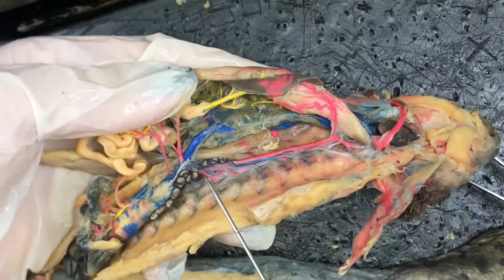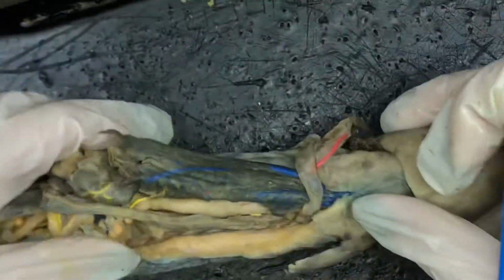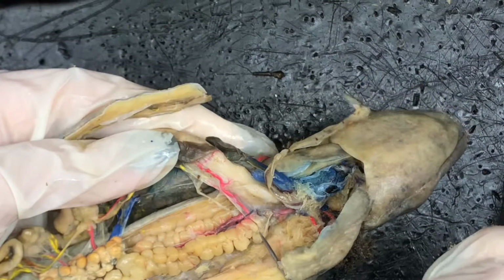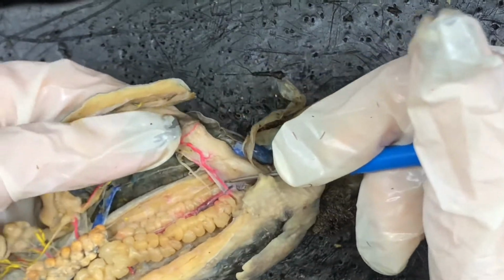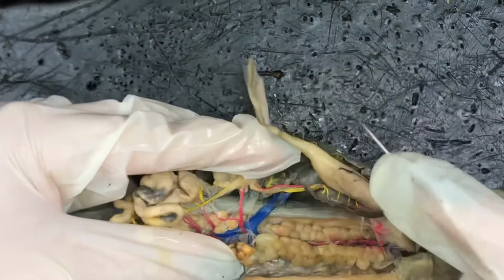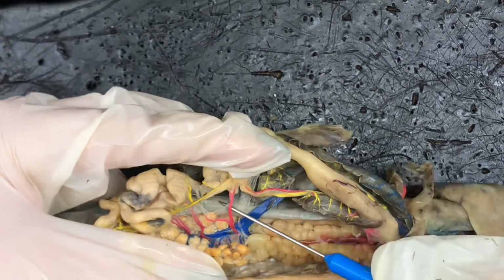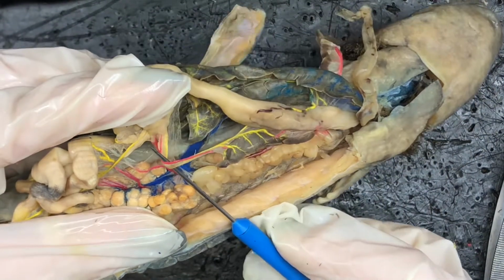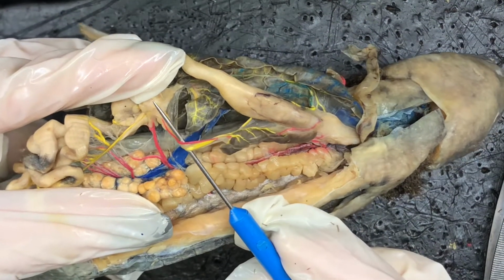And then next we're going to go down. Our next branch will be the coliaco-mesenteric artery, and we can actually see it better in this Necturus, so we're going to switch over to this Necturus and orient ourselves again. So dorsal aorta is running in here. We can see there's the gastric artery again. So the next branch, we're going to run all the way down here, is going to be the coliaco-mesenteric artery. So that's this one right here. It branches off into the splenic artery, and then also running with the splenic artery is the gastrosplenic vein. So right there we have the splenic artery and the gastrosplenic vein.